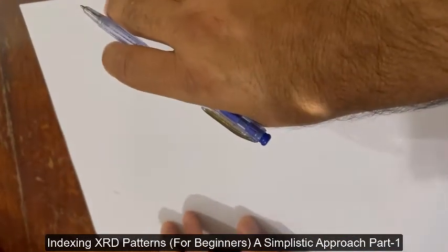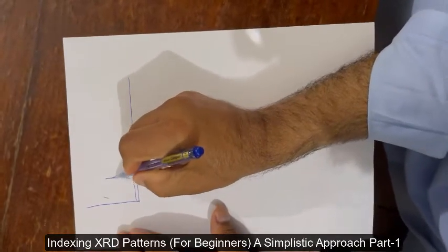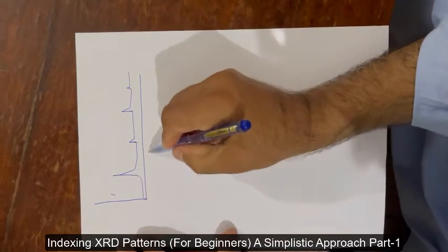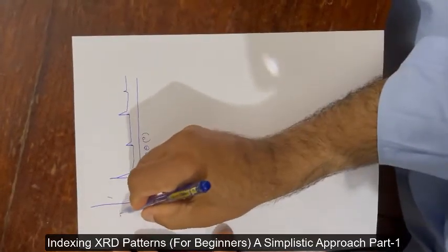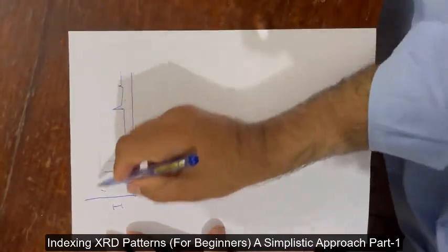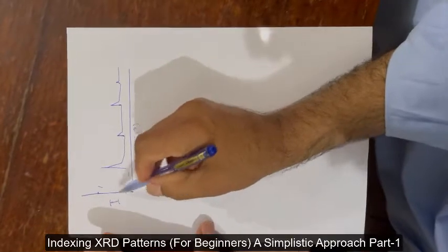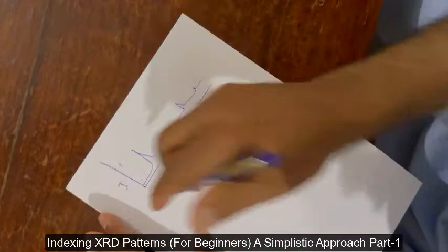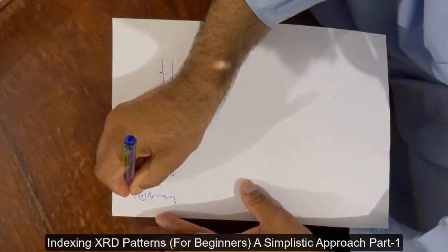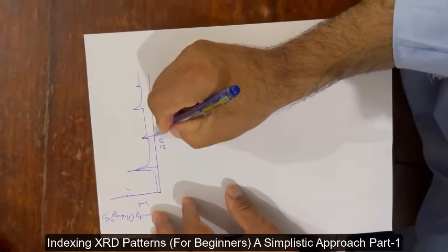You put your sample in XRD and you got a plot like this. This is two-theta in degrees and this is intensity. When there is a single plot, it shows actual intensity. If there are overlapping plots, it is arbitrary intensity because the zero of your next plot starts from here, so you label it as arbitrary intensity scale.